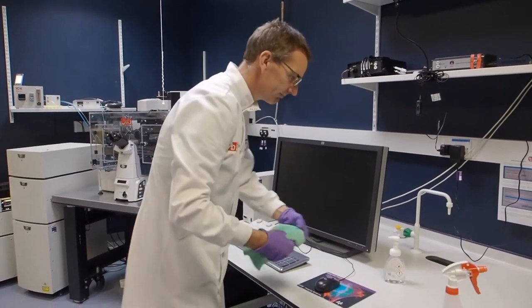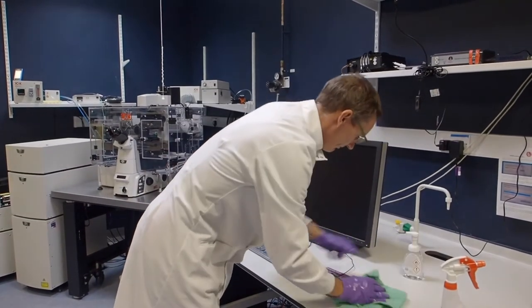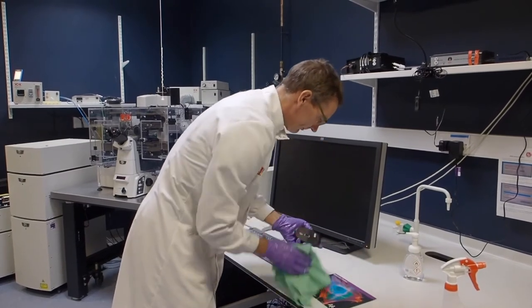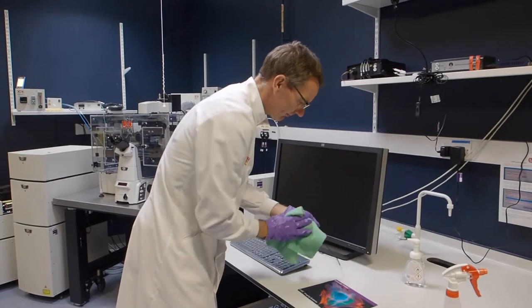Using the ethanol spray bottle, wet a green microfiber cloth and wipe down the PC peripherals such as surrounding desk area, mouse pad, mouse, and keyboard.